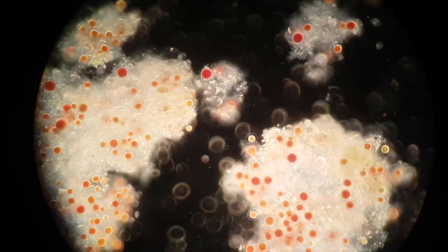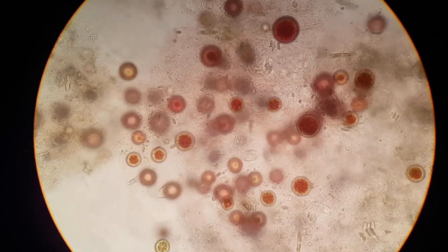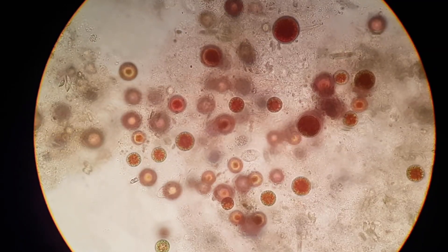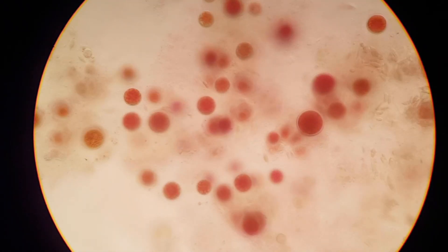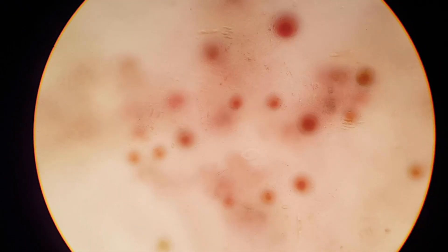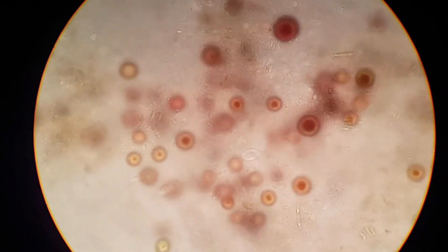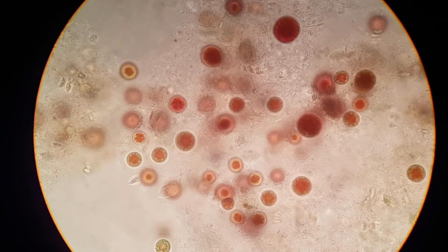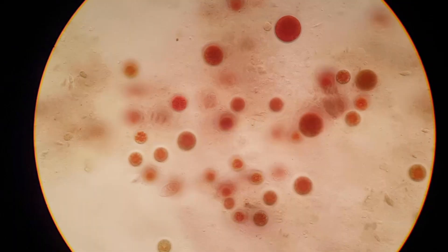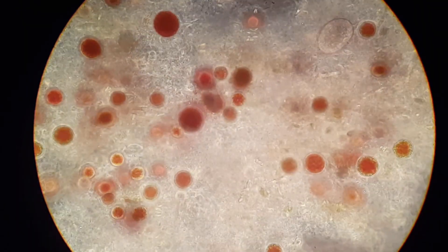The Hematococcus in the previous shot was collected in the deeper part of the water, while these cysts were collected on the surface, which is precisely the reason they are cysts — in order to protect themselves from ultraviolet radiation. As you might have noticed, they have a beautiful red color. This color is actually used as food coloring, and these little algae are even the reason flamingos are pink, because small crustaceans feed on them, turning red, and flamingos eat the crustacean, turning pink themselves. Pretty cool!